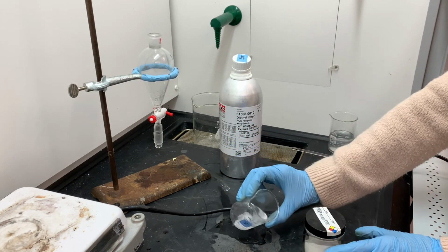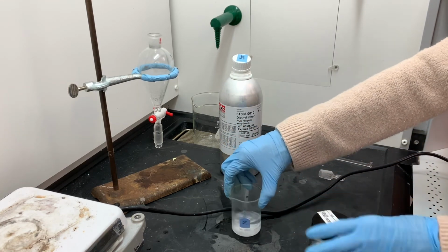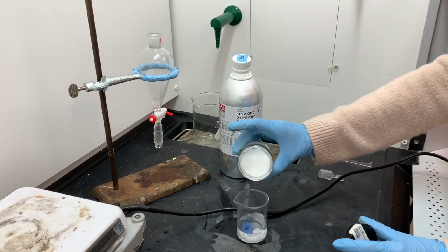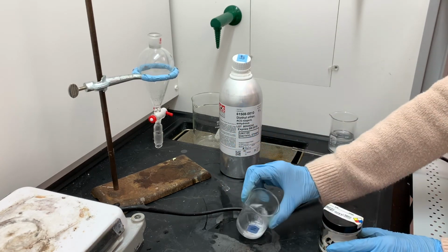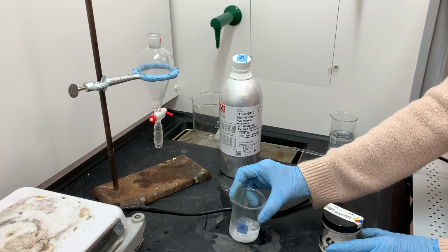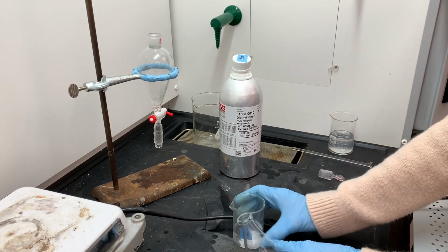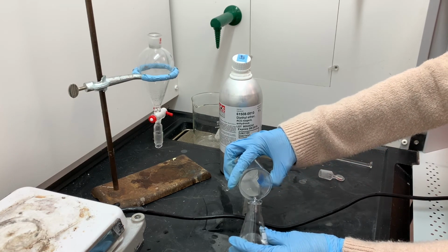Once I get this completely dried out, then I am going to transfer just the liquid, leaving behind the anhydrous sodium sulfate. I'm going to transfer the liquid into an Erlenmeyer flask. Then I'm going to cover the top of the Erlenmeyer flask with a piece of lab film. It's kind of like saran wrap, and I'll poke some holes in it. That will allow for all of the ether solvent to evaporate, and it will leave behind just the pure product. I'm going to give it a few days to evaporate fully. So after a few days have passed, and the ether has evaporated, then we will characterize the product.